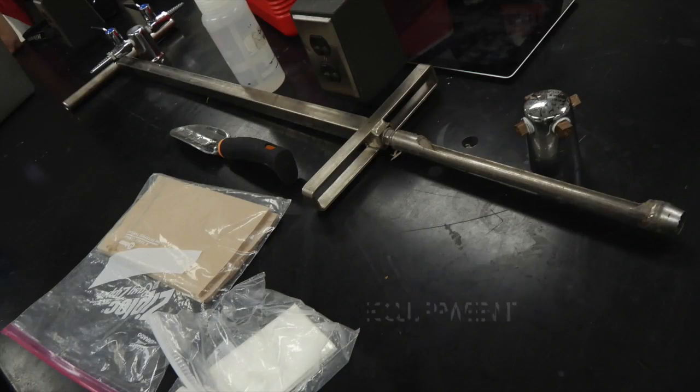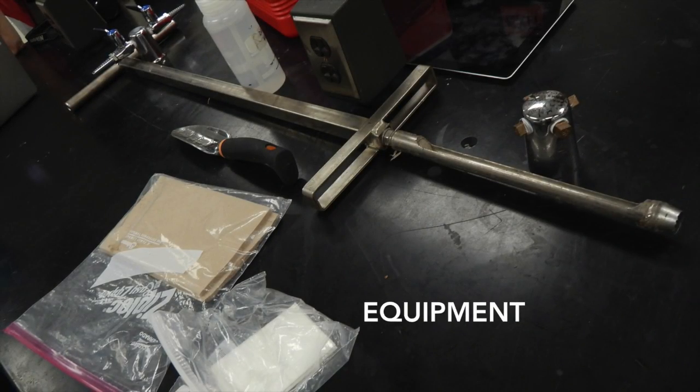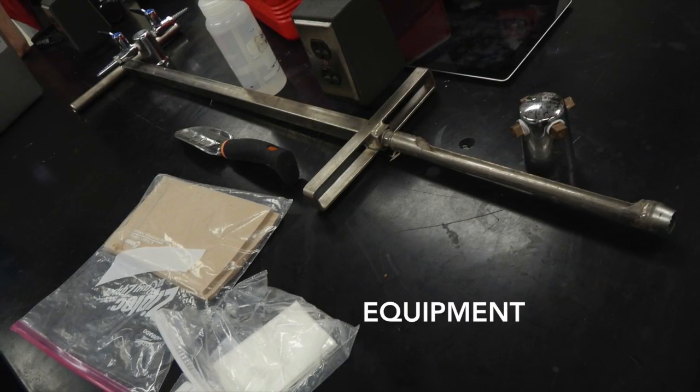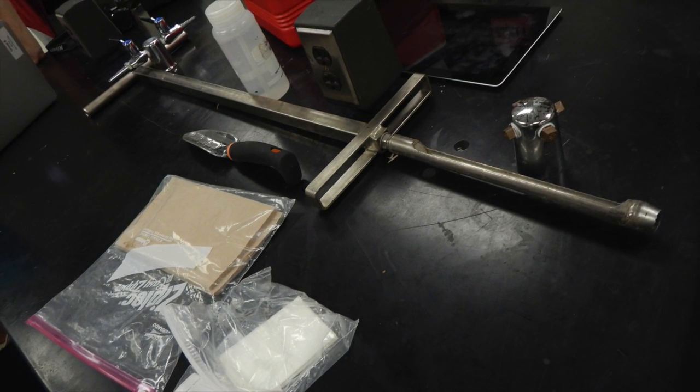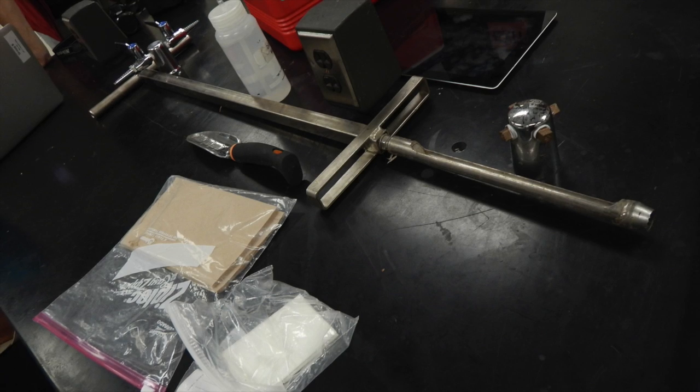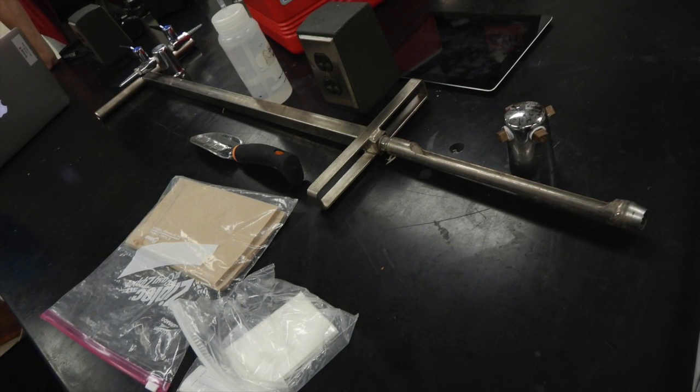Soil samples may be collected using a variety of methods and equipment depending on the depth of the desired sample, the type of sample required, and the soil type. This video will display an example of soil sampling using the T-handle auger method.